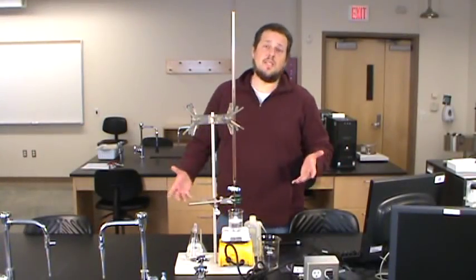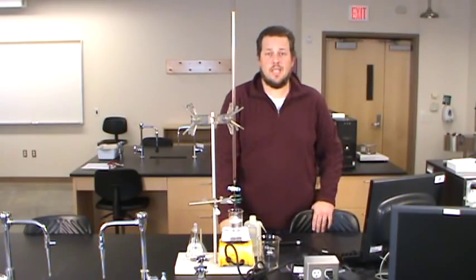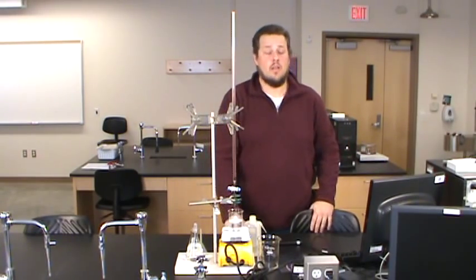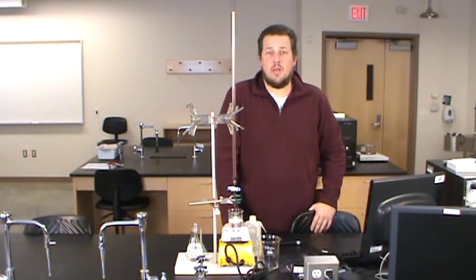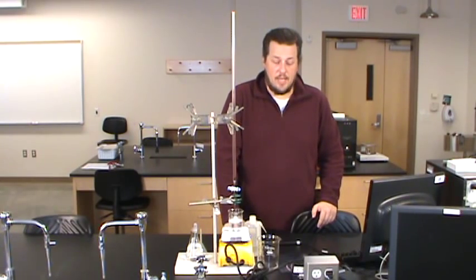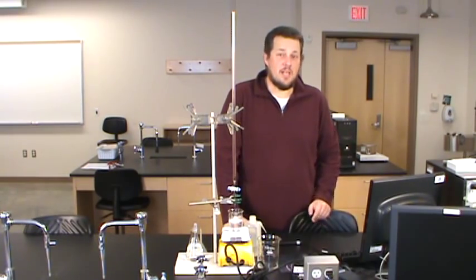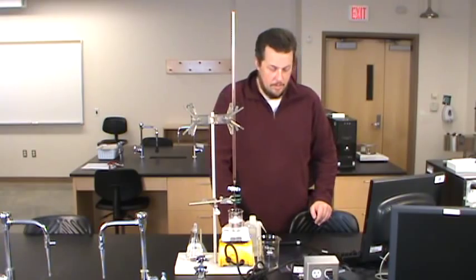That was a qualitative look at conductivity — we looked at it as just a matter of more or less, or none. But in order to do our experiment, we'd like to be able to quantitatively look at conductivity. To do that, we need a little more sophisticated instrument than a light bulb with two wires dangling under it.